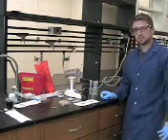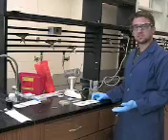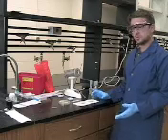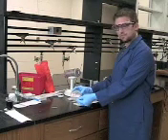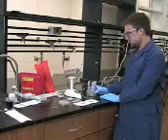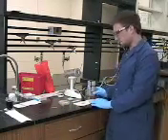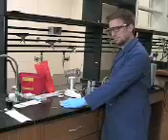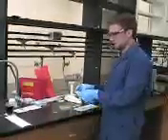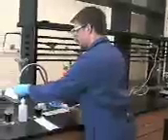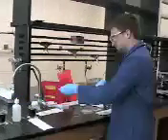So once you have your circles drawn, we're going to now start our staining by getting our slides ready. We're going to do this in two ways: one, by getting bacteria from a plate, or getting it directly from liquid cultures. I'm going to start off showing you how to get it from a plate. So first you're going to want to get some water in a little dish, not too much, just enough to be about halfway or so.